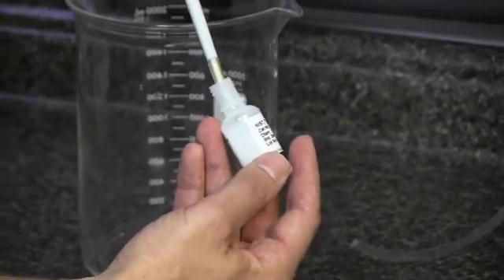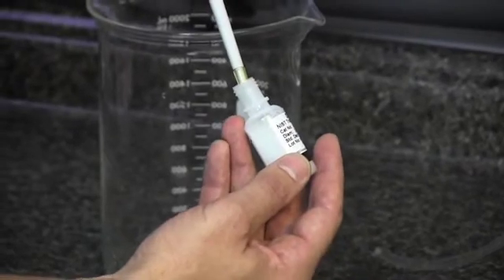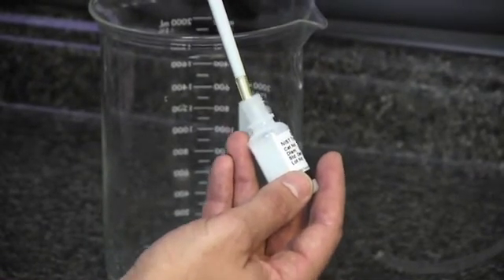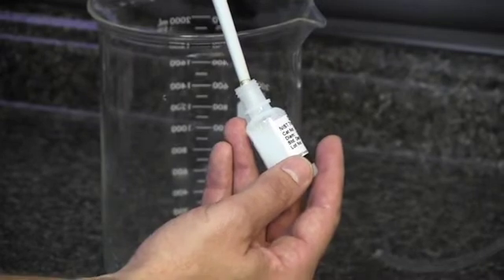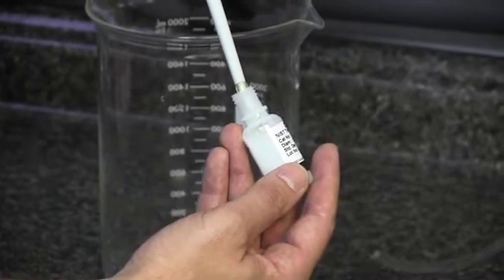And then you're going to insert the pipette tip into the bottle. And if you look at the side here, you want to make sure you get the tip below the surface of the liquid. You don't want it at the very top where you might pull in air. So just get it fully submerged and then release the plunger.